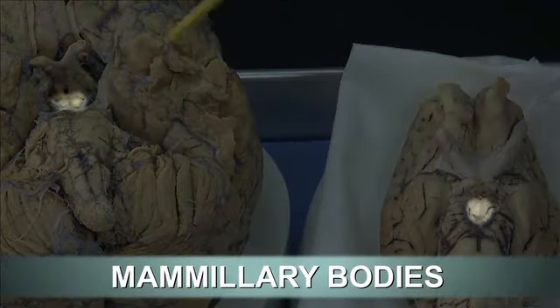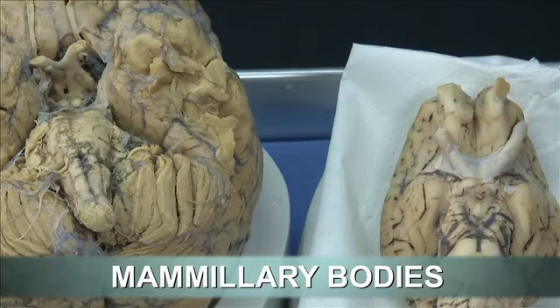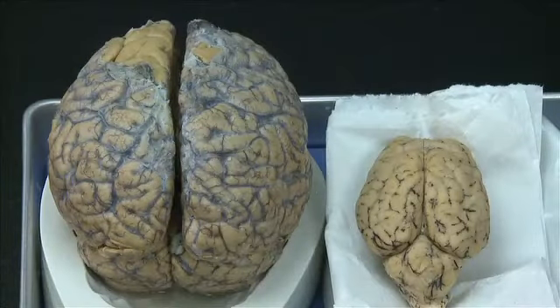There are 2 mammillary bodies in the human brain, and there is 1 in the sheep brain. But in the sheep brain, the mammillary body is much larger with respect to the size of the brain than in the human brain. The final obvious difference between sheep and human brain is the size.